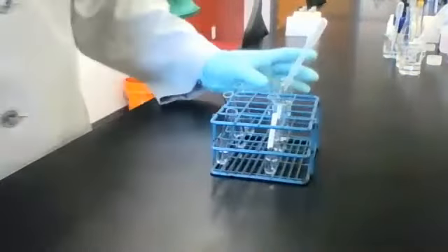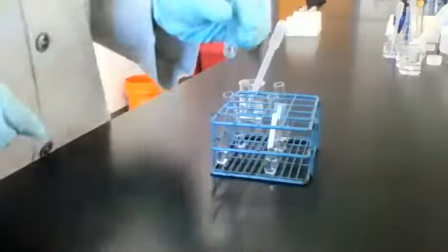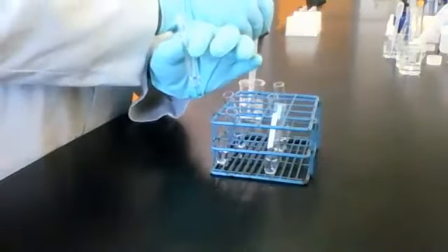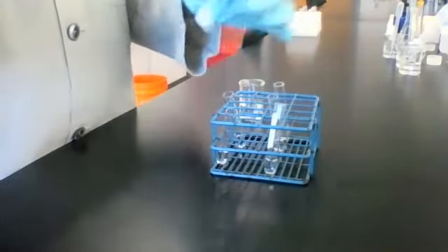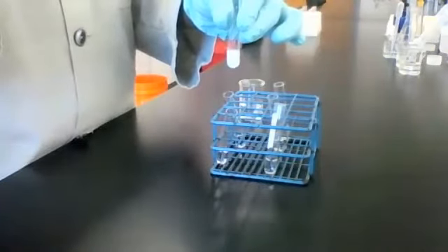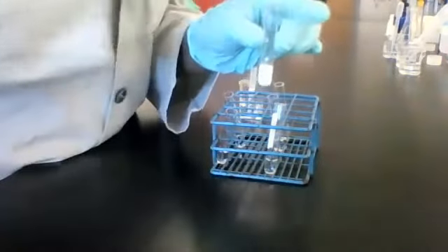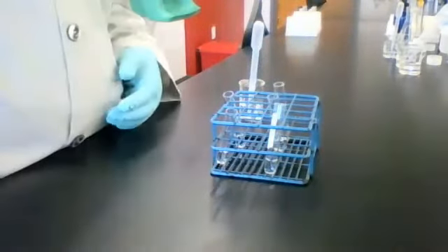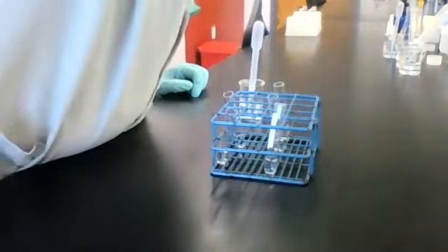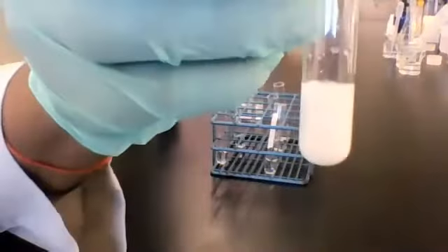Last but not least, let's try reagent C. Yes? All right, here's solution 1, which is NaCl. Let's see what happens. Reagent C. Sorry? Well, that is solid dispersed throughout it. But I do also see something at the bottom. All right, here's the resulting mixture.